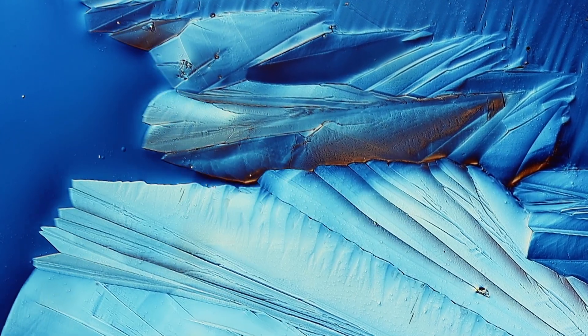Hi, hello and welcome again. Microbe Hunter here. Well, these beautiful patterns that you see here on my computer screen, these are crystals of citric acid under polarized light, yes, directly streamed from my microscope.